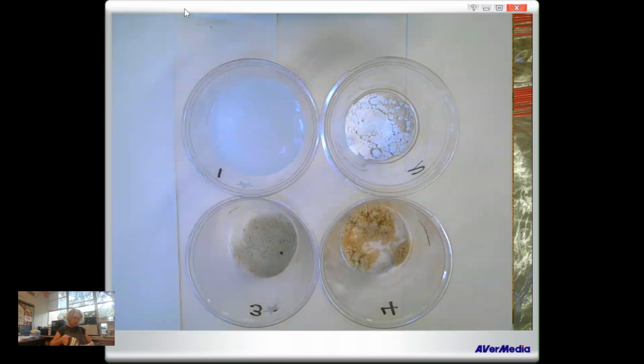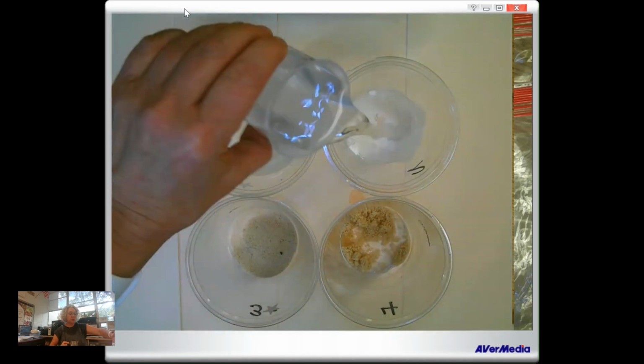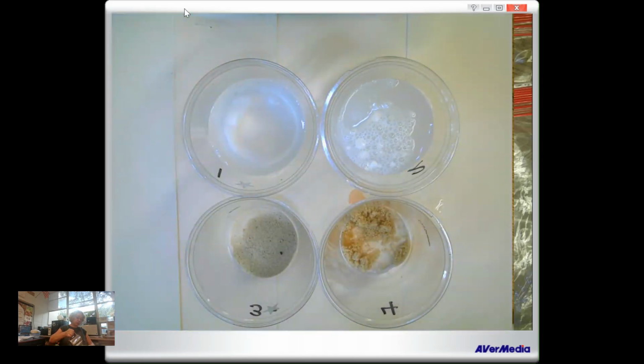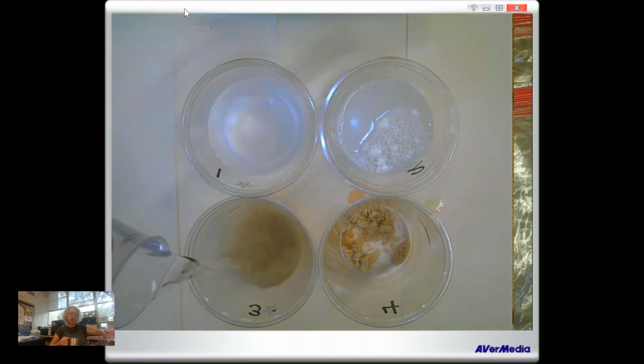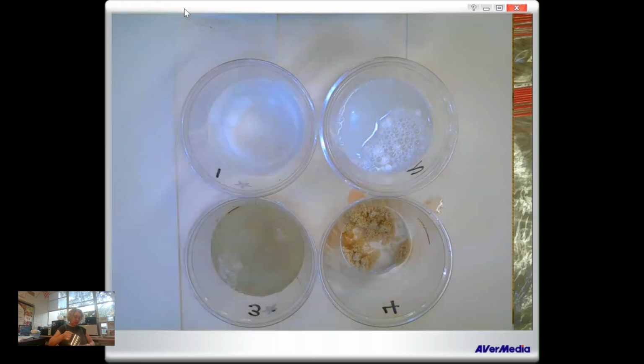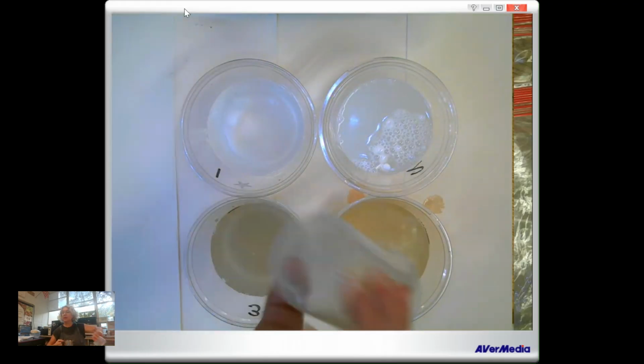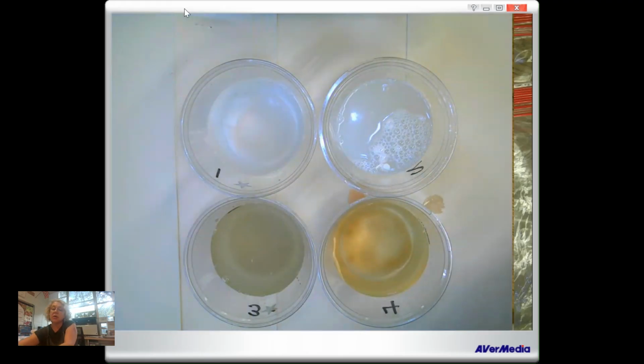For 1, 2, 3, and 4. Excellent. Okay, so we're going to stir each one up.